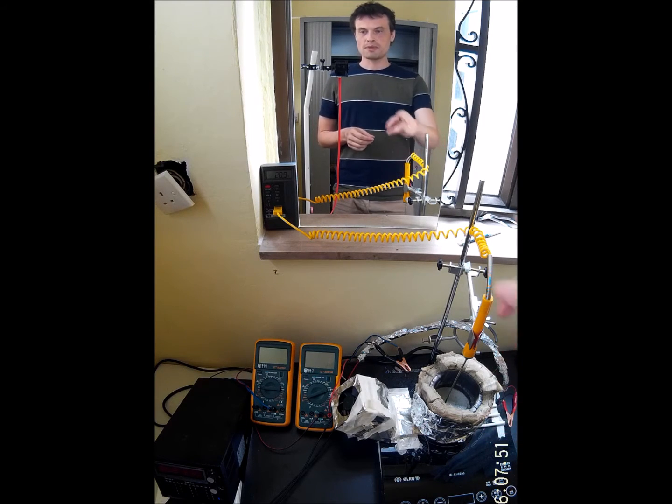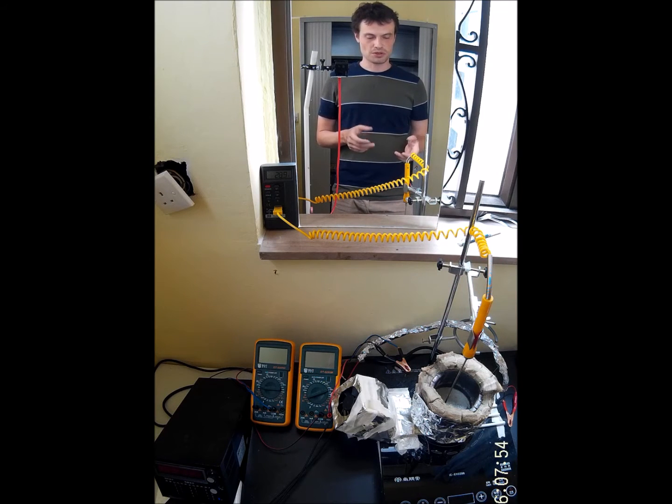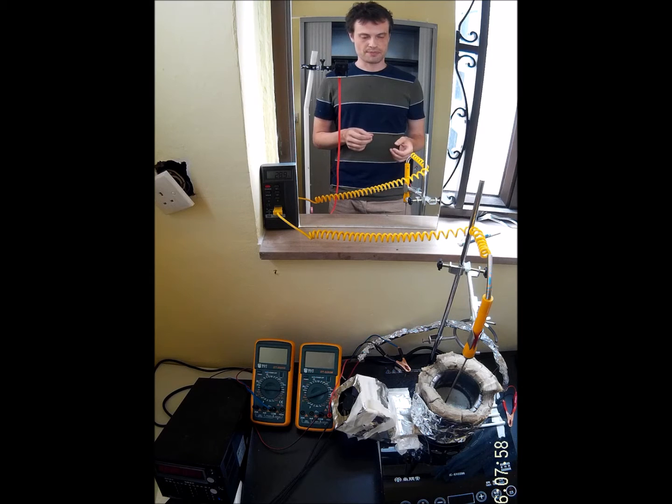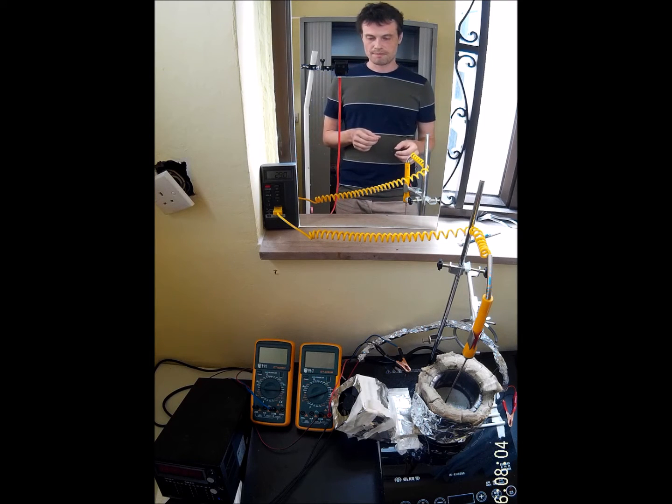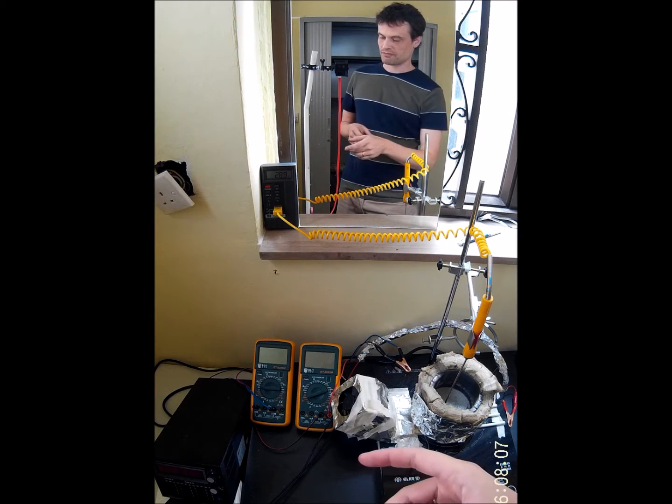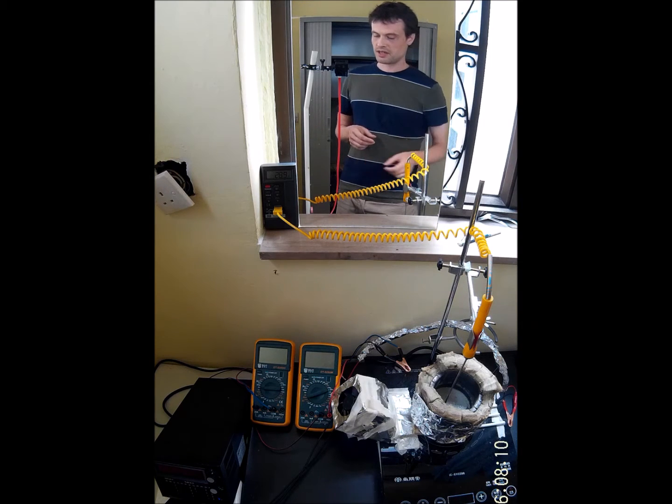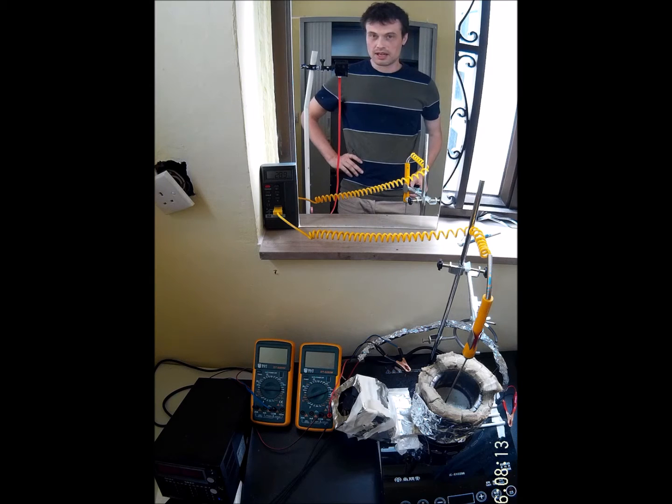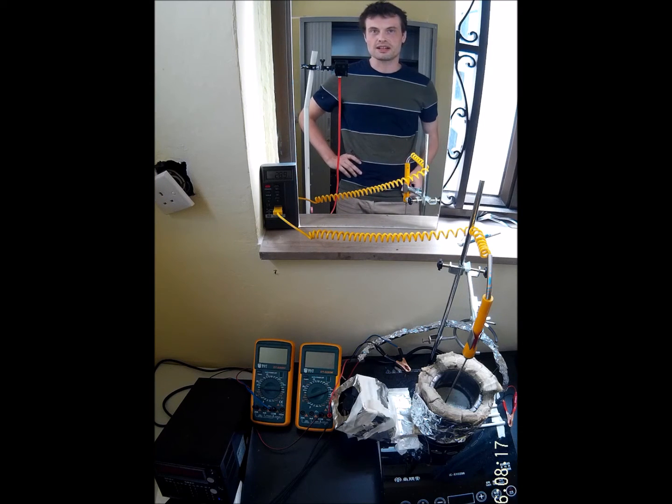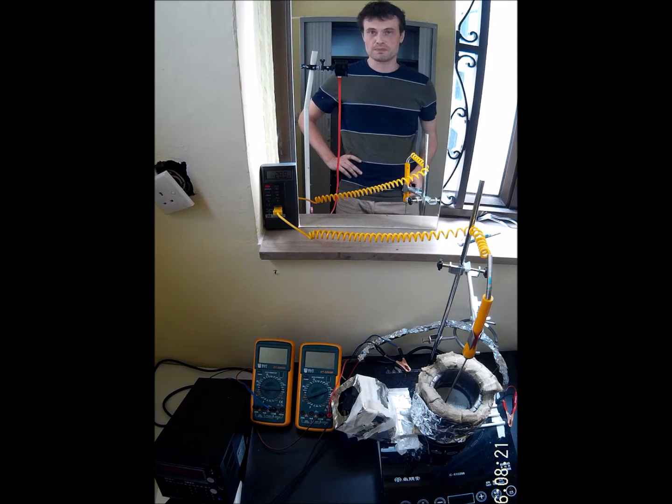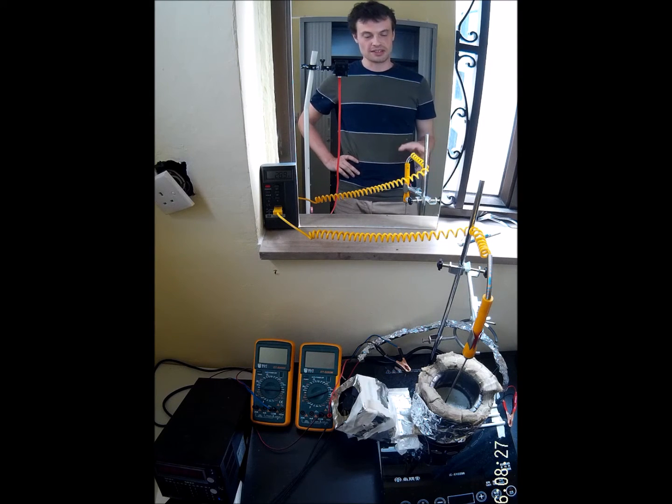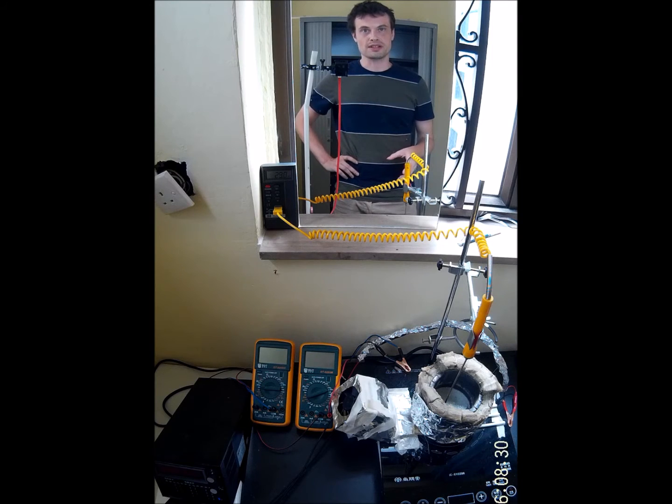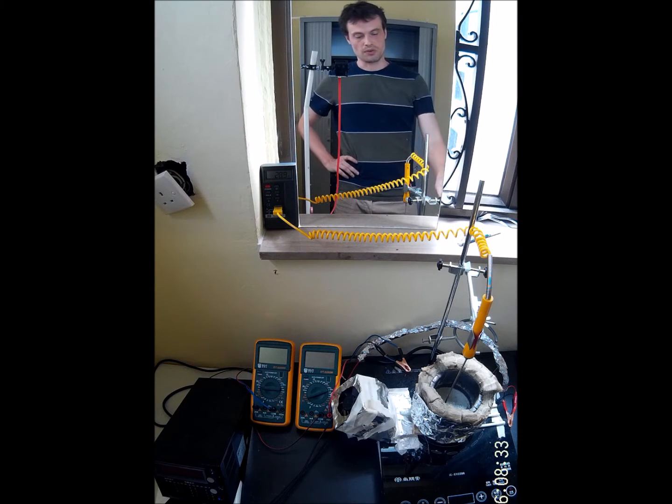I have a thermometer here that tells me how hot the lithium carbonate is. It should be 730 degrees at least for this. I have a low voltage high current DC power source, and then I have some multimeters that I can use to measure the voltage and the current. And then I have the electrodes, the nickel anode and the galvanized steel cathode.